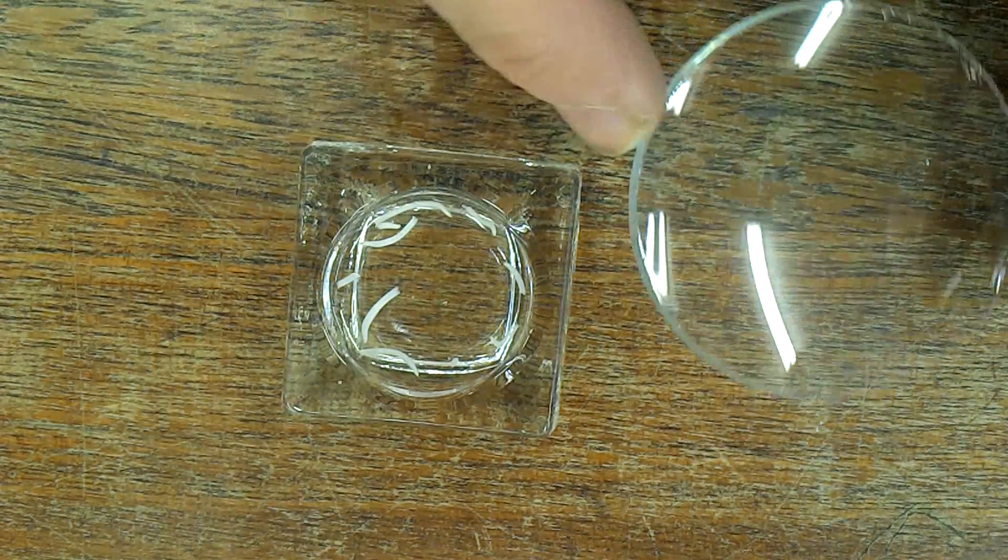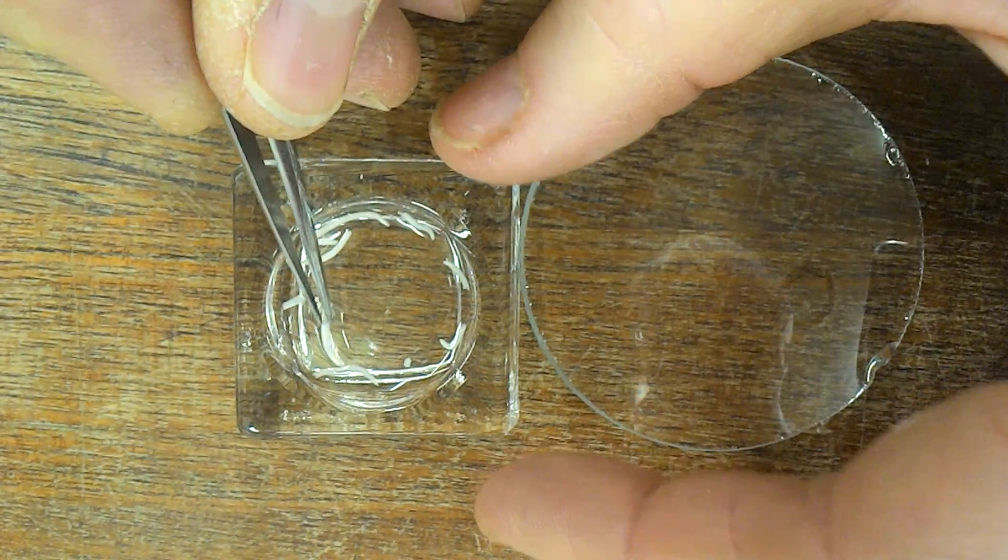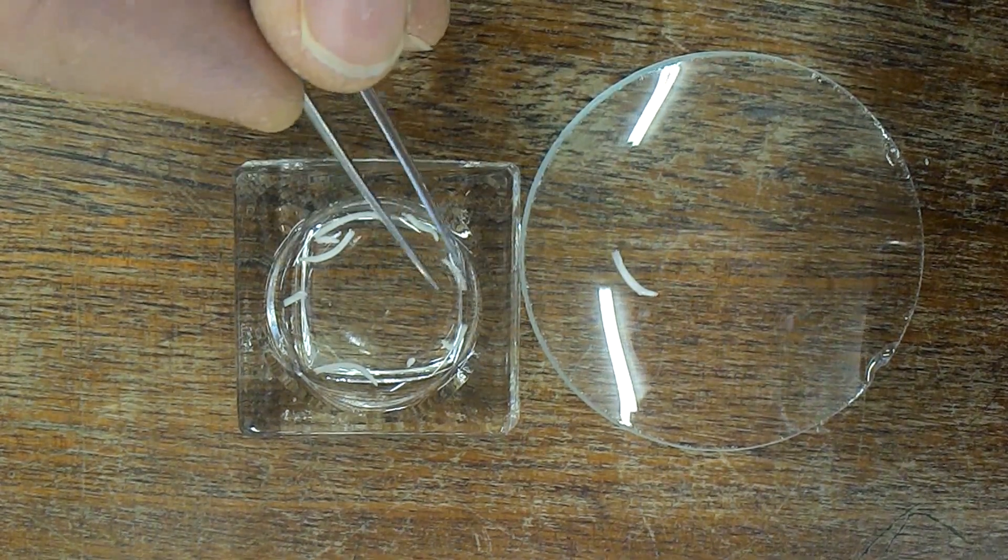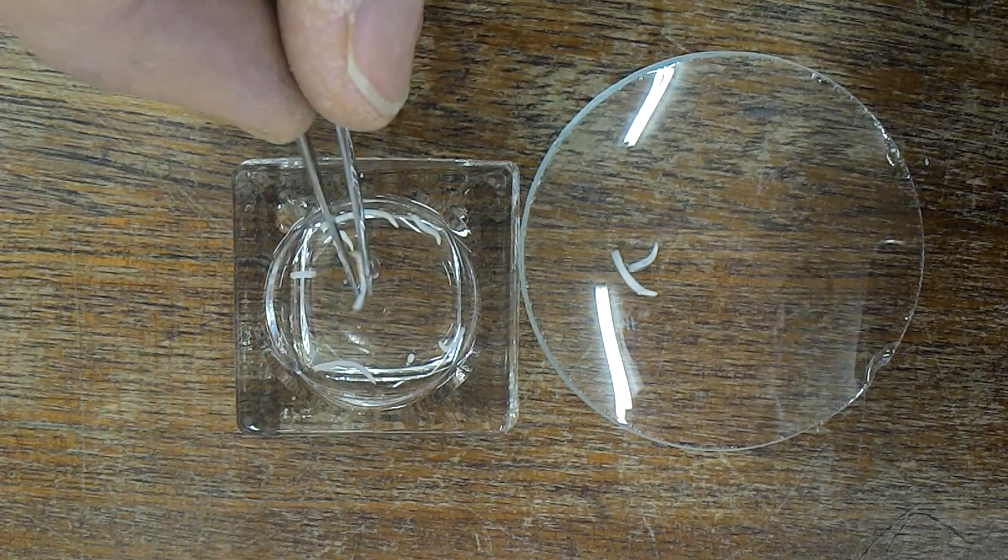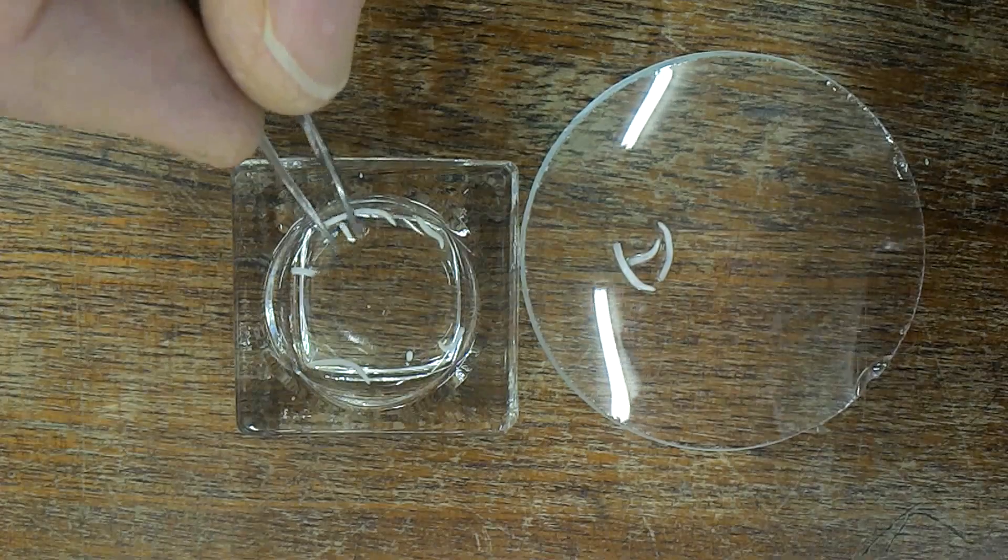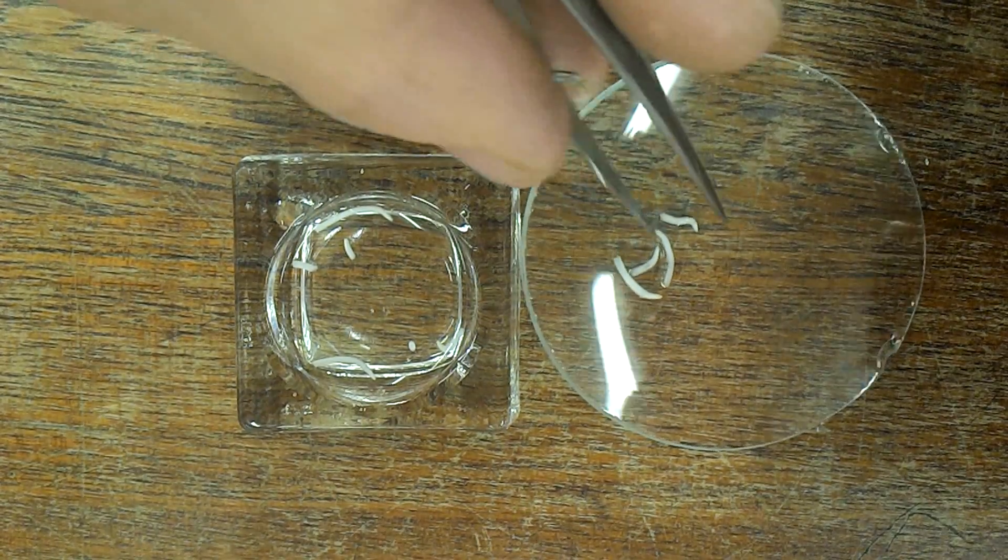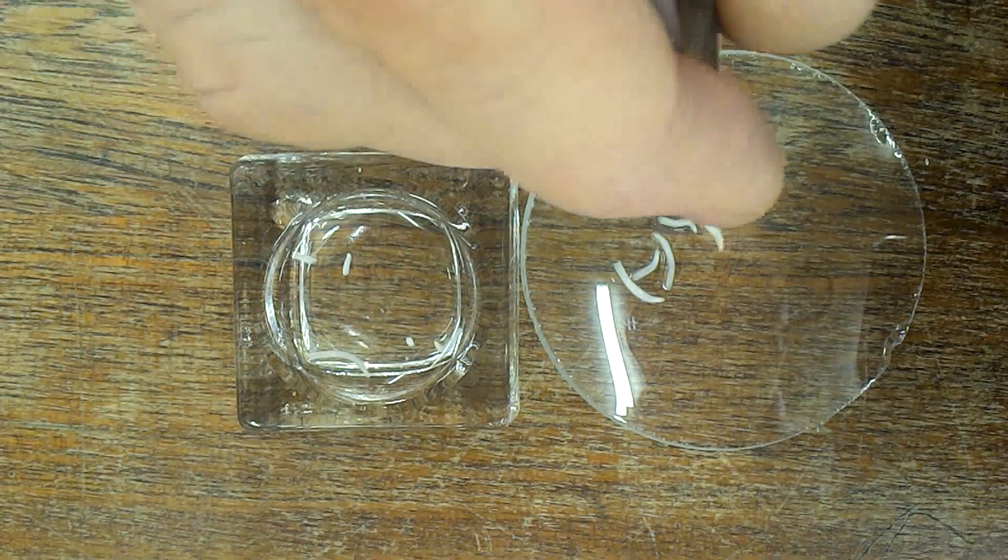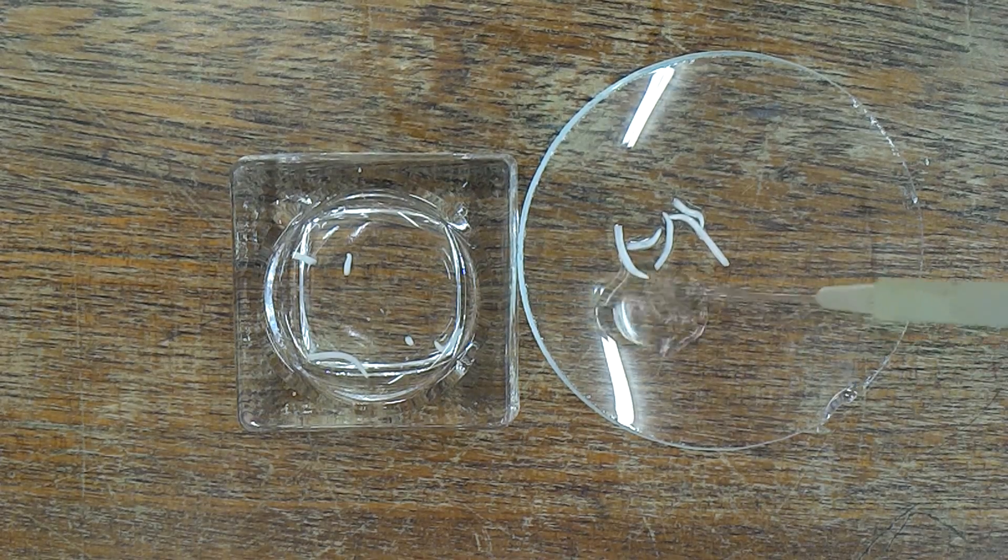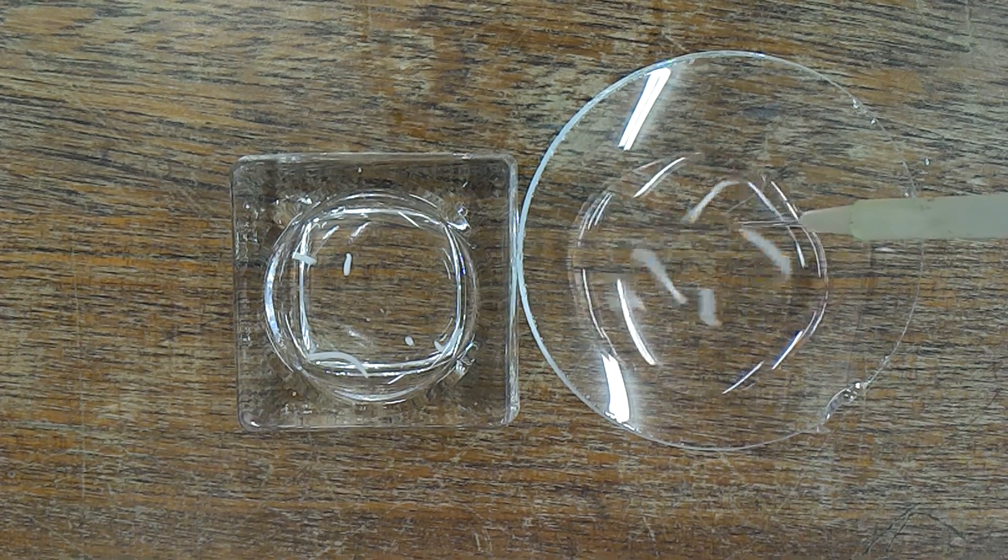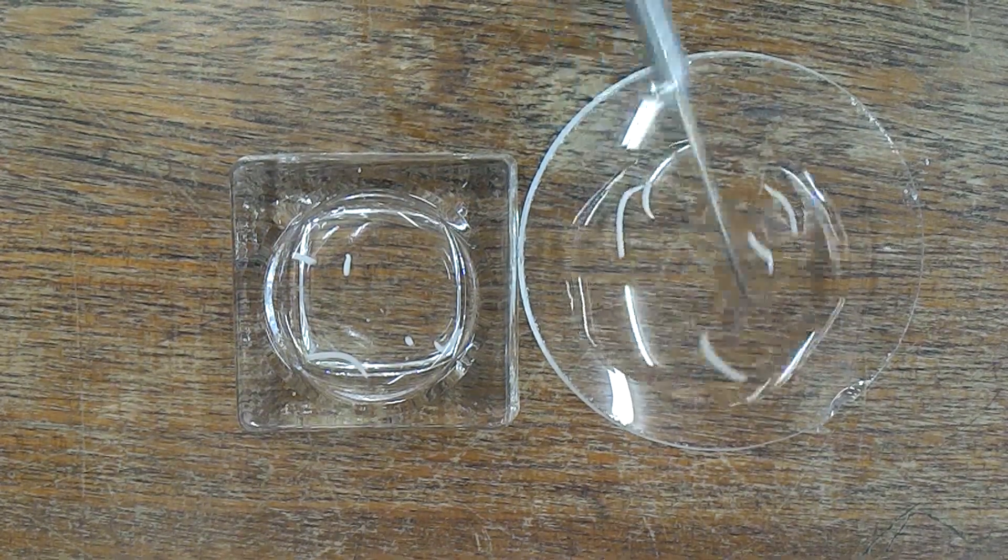Now we're going to take these tips and wash them with cold water. Carefully transferring them, we'll transfer five of these out of the acid, and then wash them with cold water to make sure the acid is washed off.